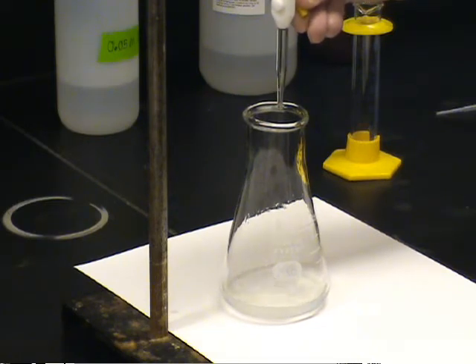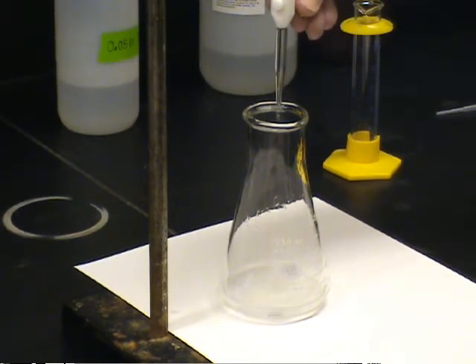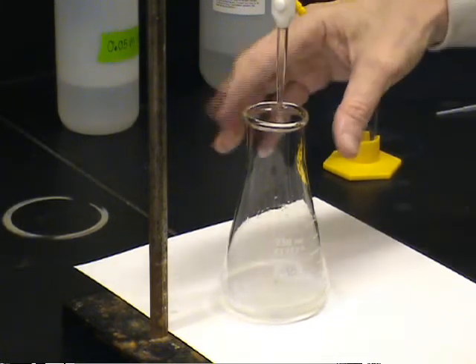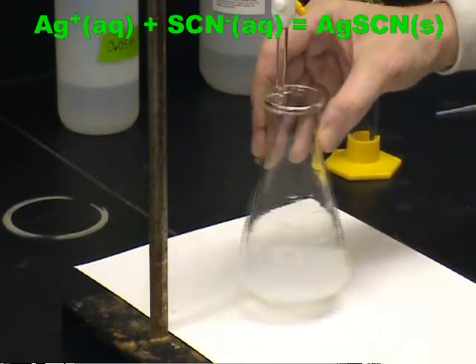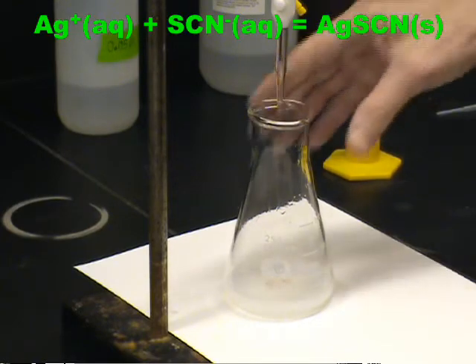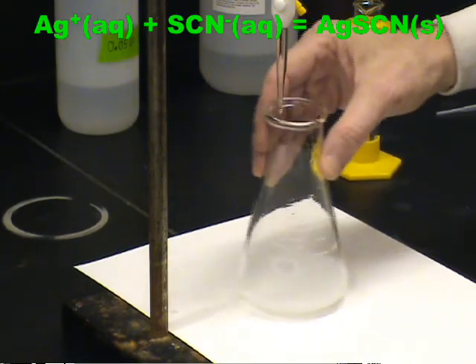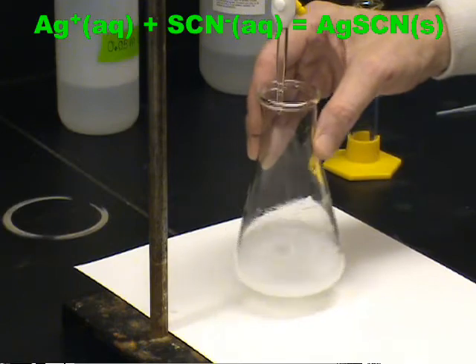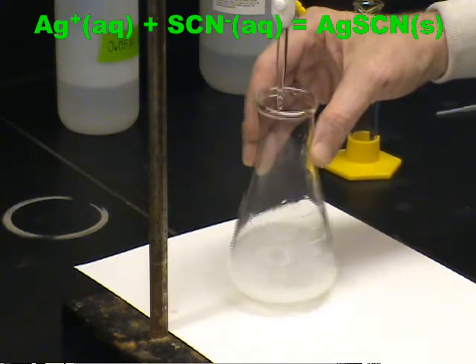Remember that our goal is the determination of the solubility product constant for silver acetate. To do this, it is necessary to determine the concentration of the ions in solution. The concentration of silver ion is determined by titration with potassium thiocyanate. Silver thiocyanate is much less soluble than silver acetate, so that as the titrant is added, you should begin to see the formation of a white precipitate. This is silver thiocyanate.